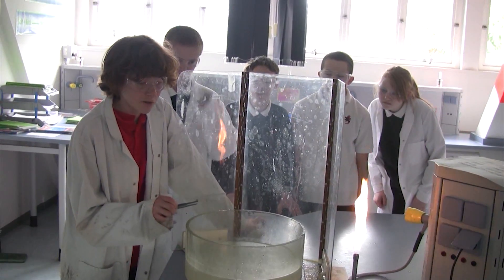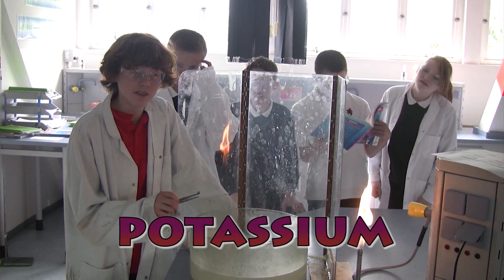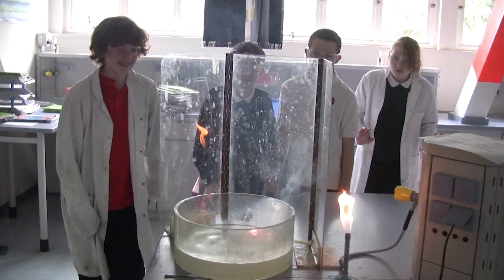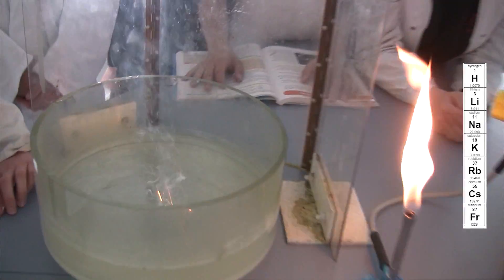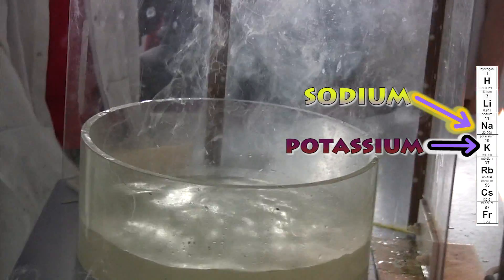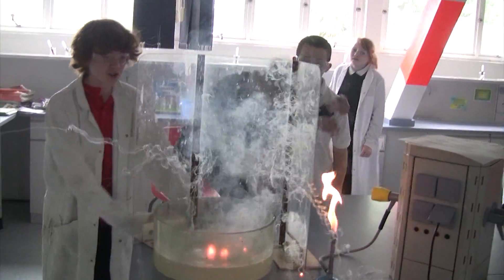This time we're going to be reacting potassium with water to see what happens. It should be a little bit more interesting. The alkali metals are in group one of the periodic table. The further down the group you go, the more reactive the metals get. Potassium is below sodium in the group and is therefore more reactive with the water. The reaction here is sufficiently violent for the hydrogen to ignite in the air.